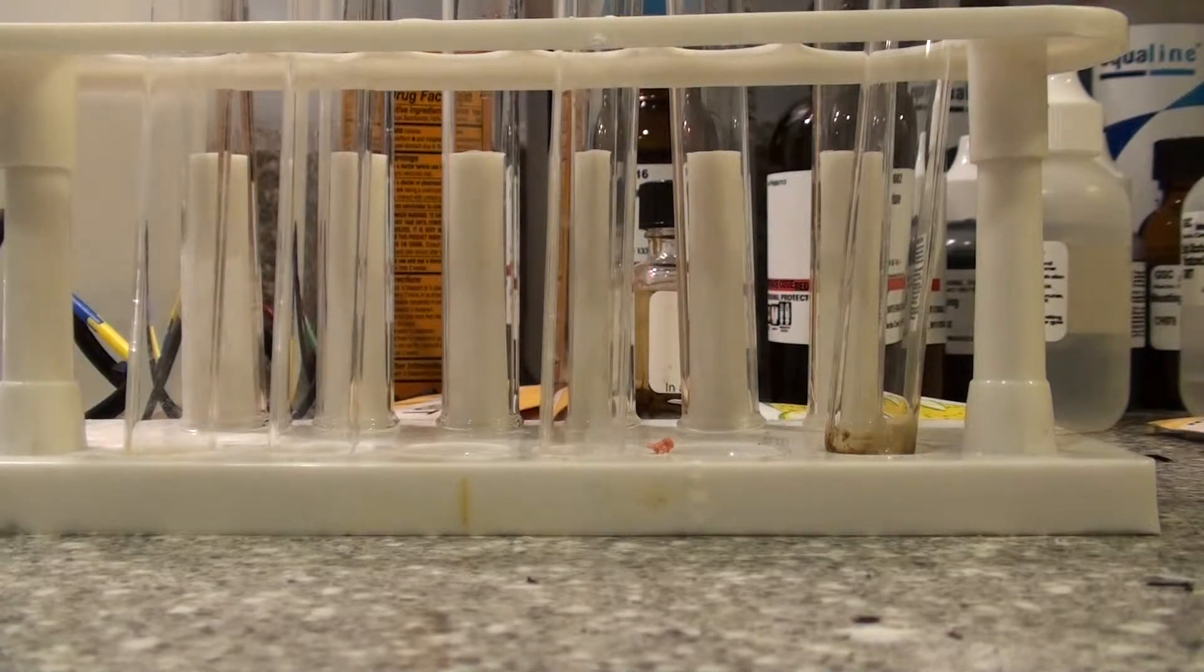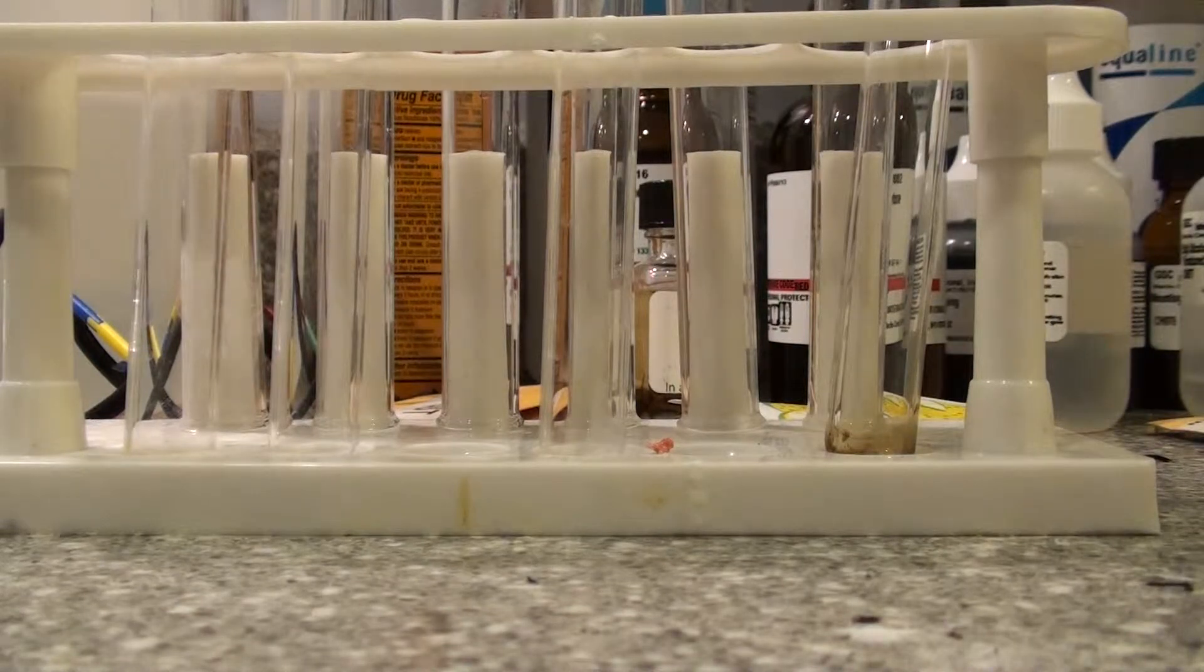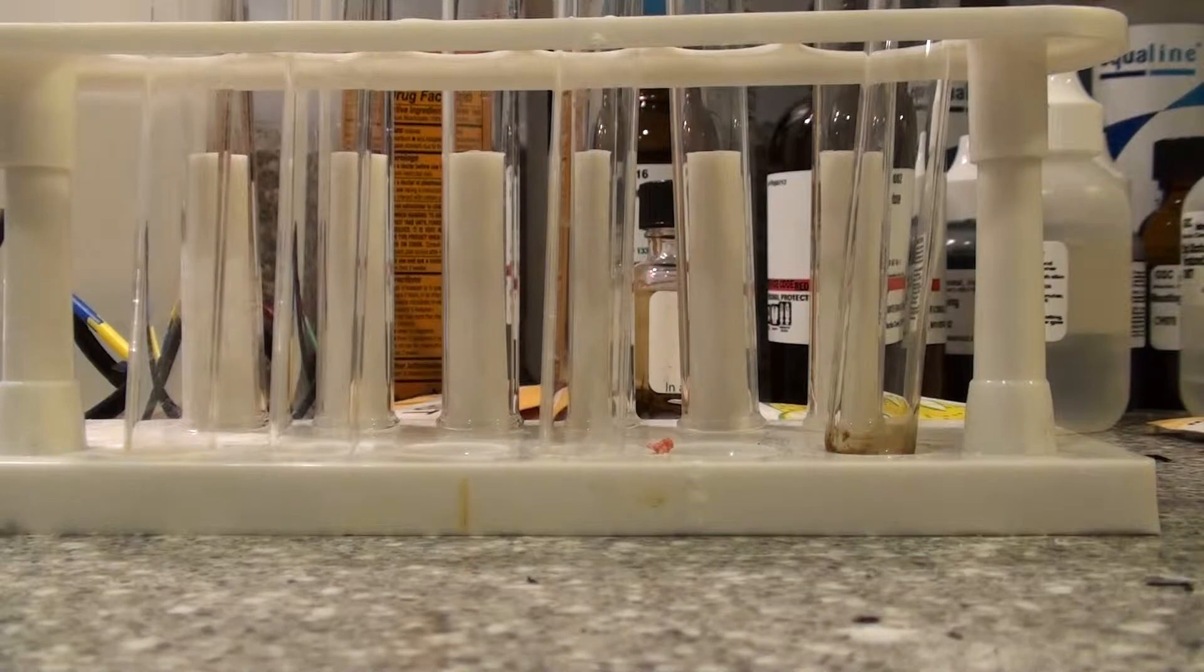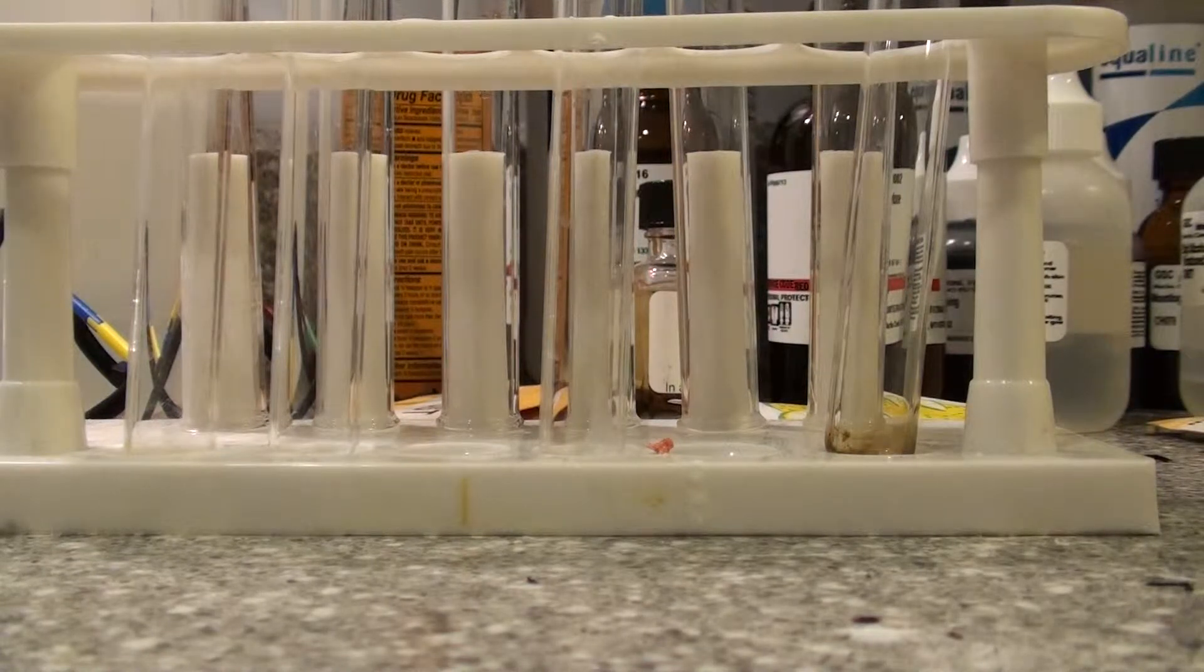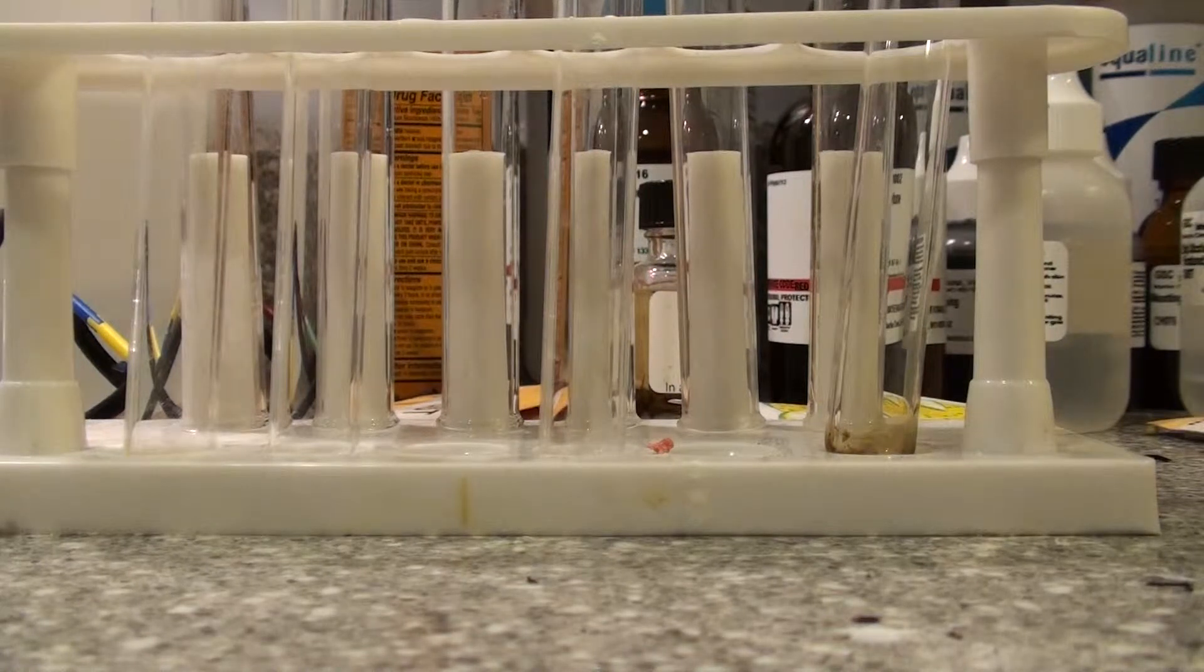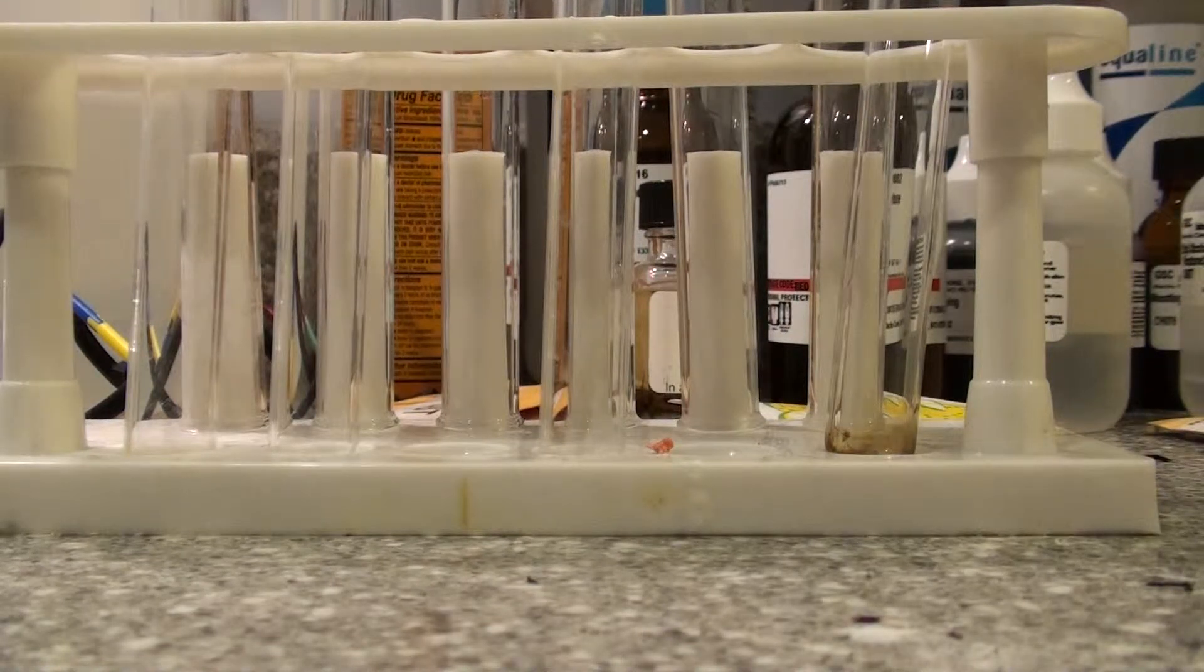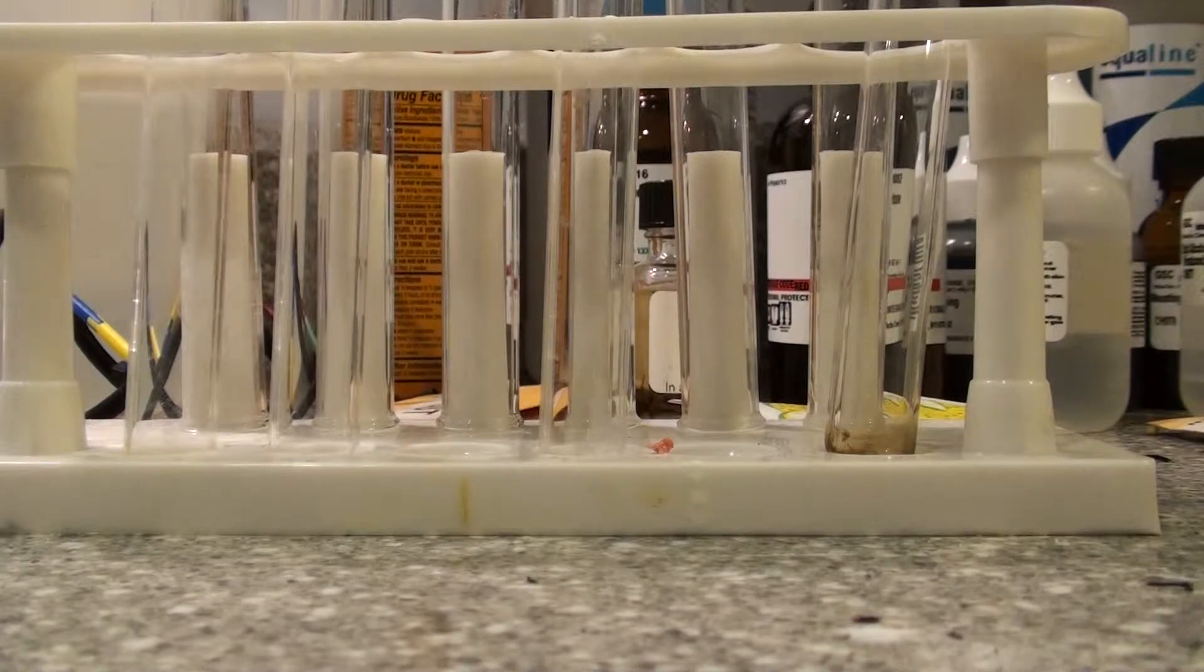Anyway, first we need to melt and stir and mix together one part Ammonium Chloride and two parts Distilled Water. If you use regular water, this experiment will not be as awesome. It will not show up as better.